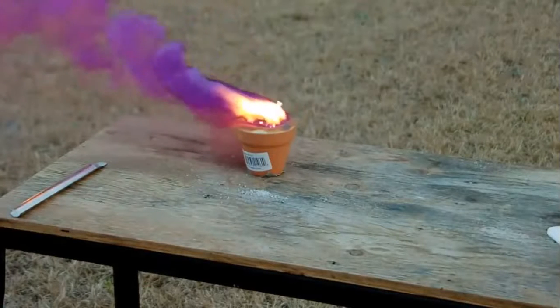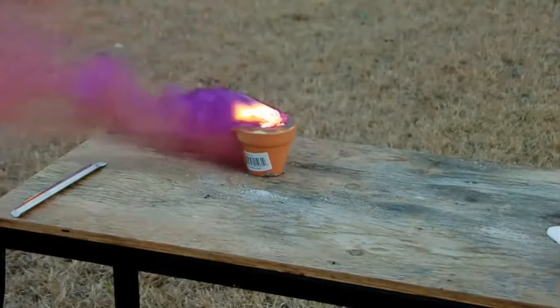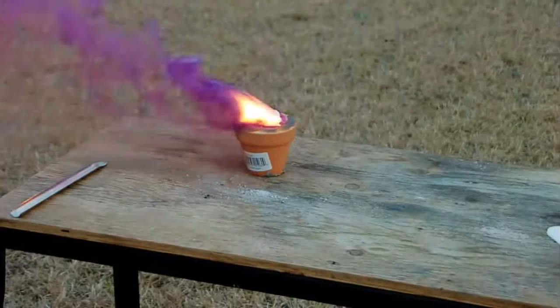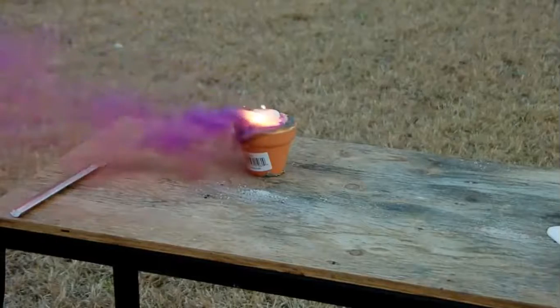It's perfectly safe. And you can see this is very exothermic. We're producing a lot of heat. We're producing a lot of light. So back at the beginning of the chapter, we said, what are the indications of a chemical reaction? We said it produces heat, it produces light, produces a gas sometimes. And we have all three of those in this instance.